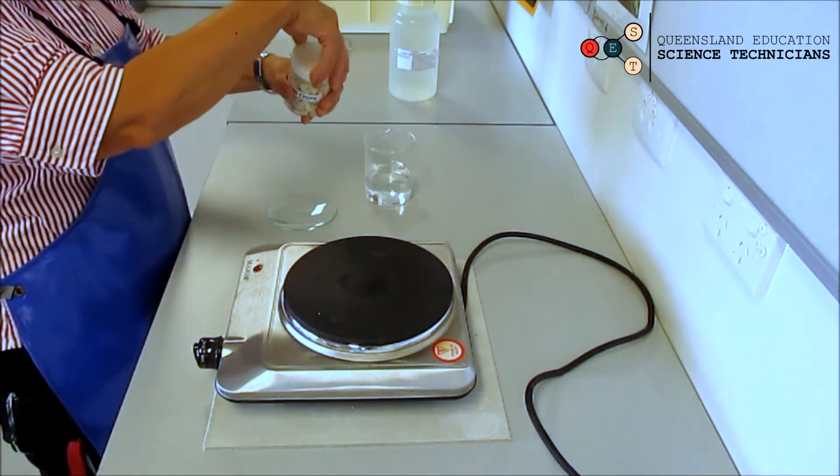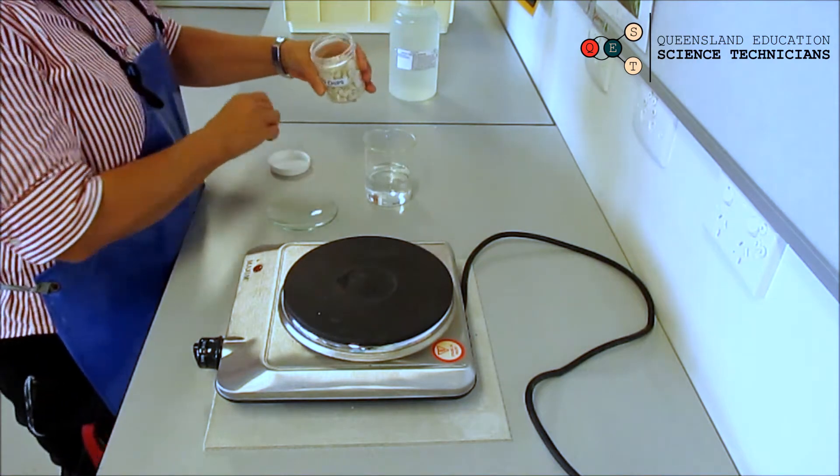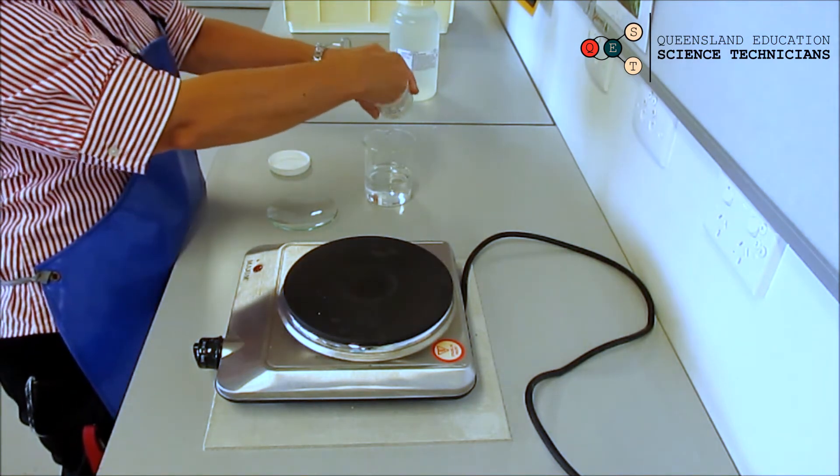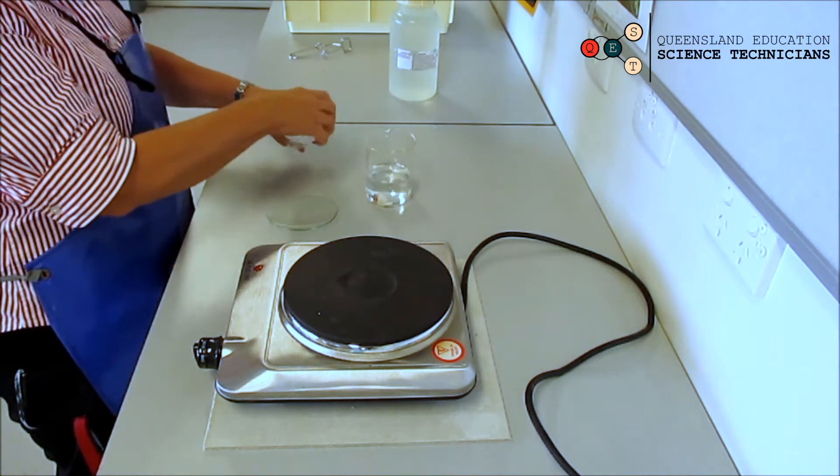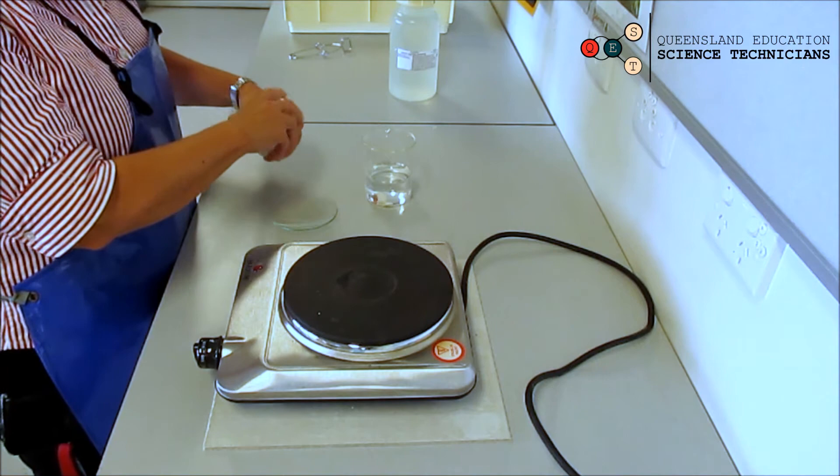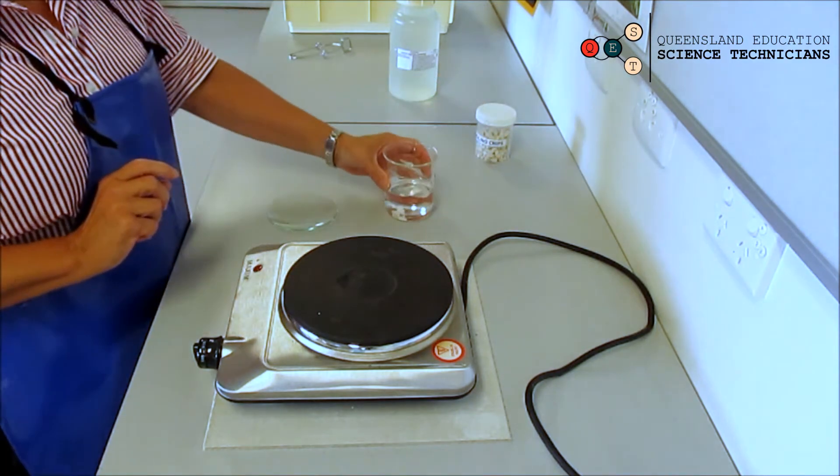Then you get your boiling chips. Your teacher will come around with your boiling chips and give you two or three boiling chips that you can put into your beaker.